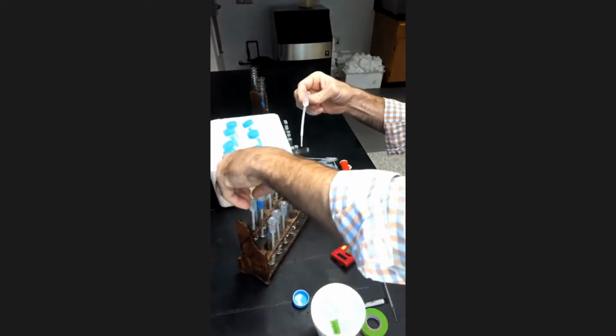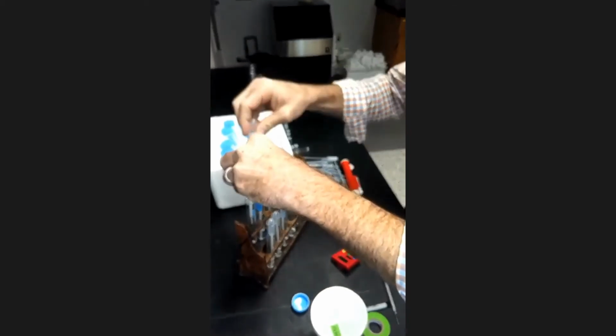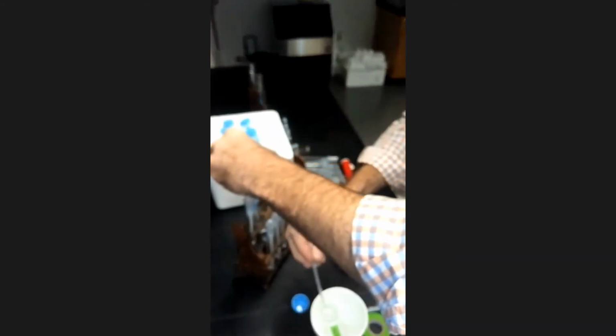And as soon as I put that into tube 1, I'm going to start my timer. As it runs, I'm going to just pipette up and down to mix in that reaction tube so it's thoroughly mixed, and then prepare myself to add into my next tube at the 20-second mark.